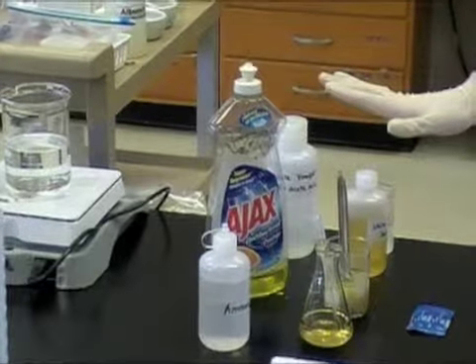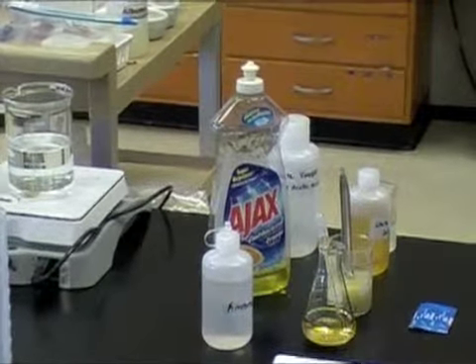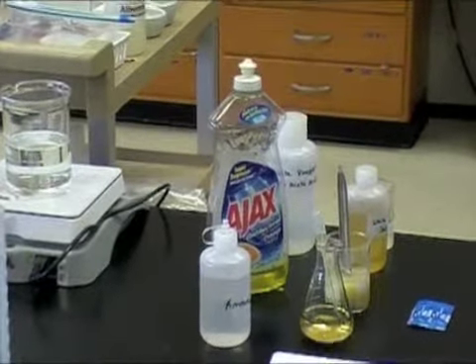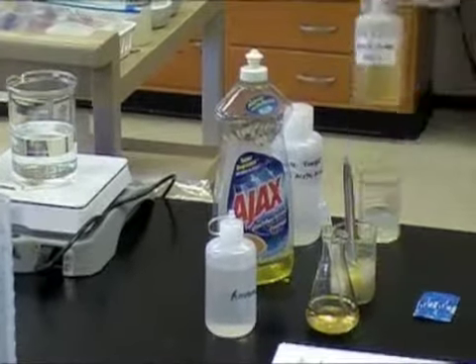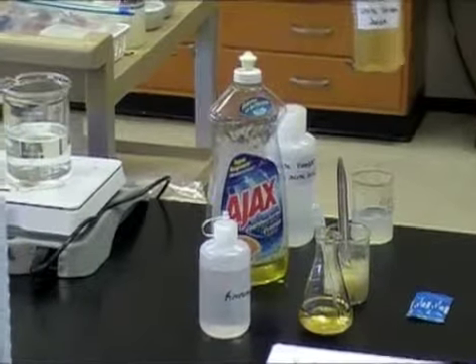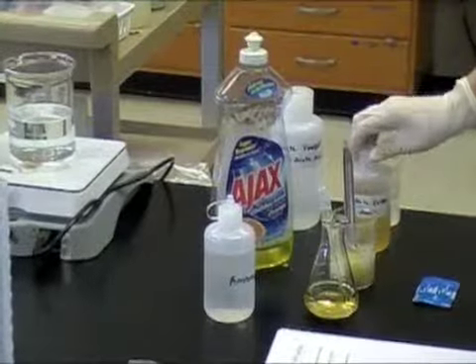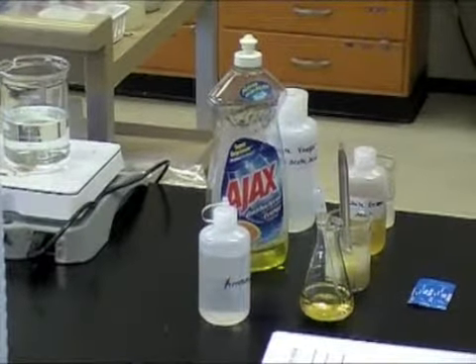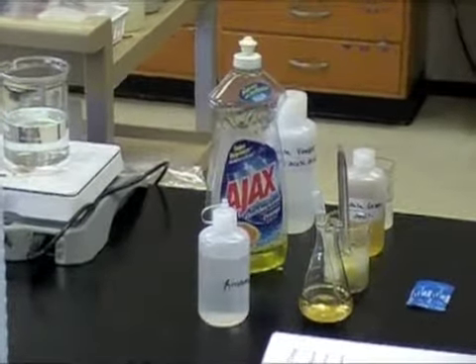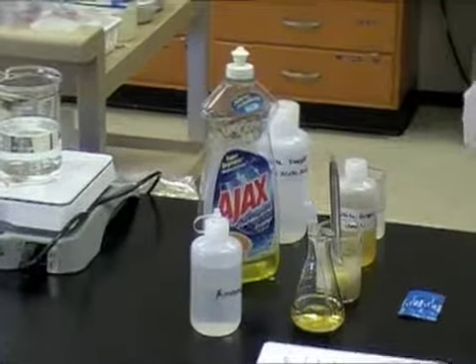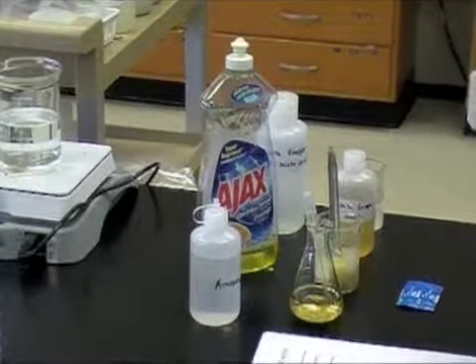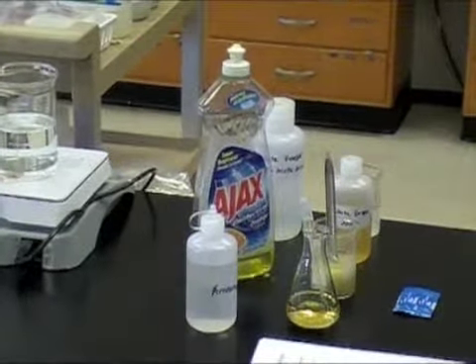You need one small can of white potatoes, which is not shown here. You're also going to need one small bottle of white grape juice or a little box. I've got one actually in a little bottle here, some white grape juice. You need one small can of white navy beans, which is not shown, and an old toothbrush for washing your test tubes. And please do not use it to brush your teeth after using it for that.